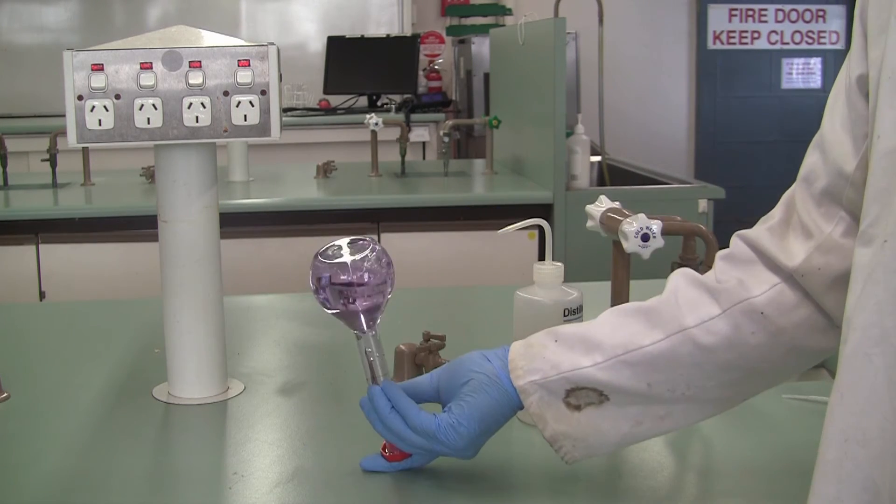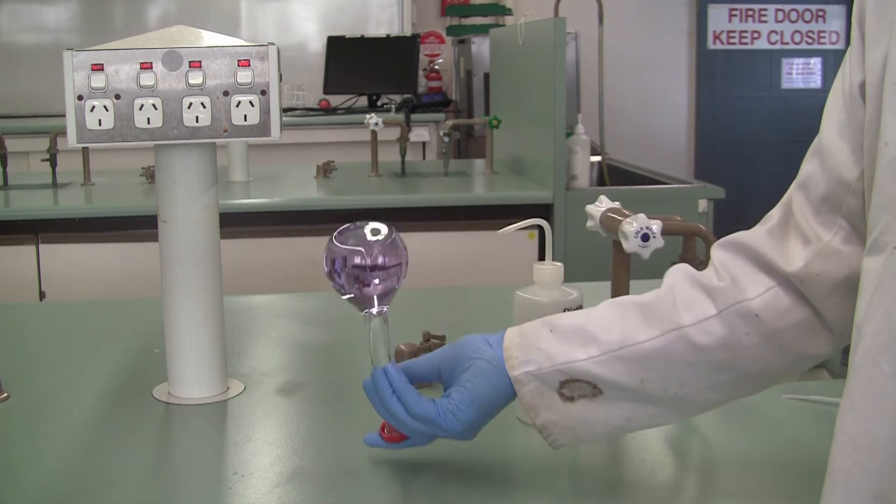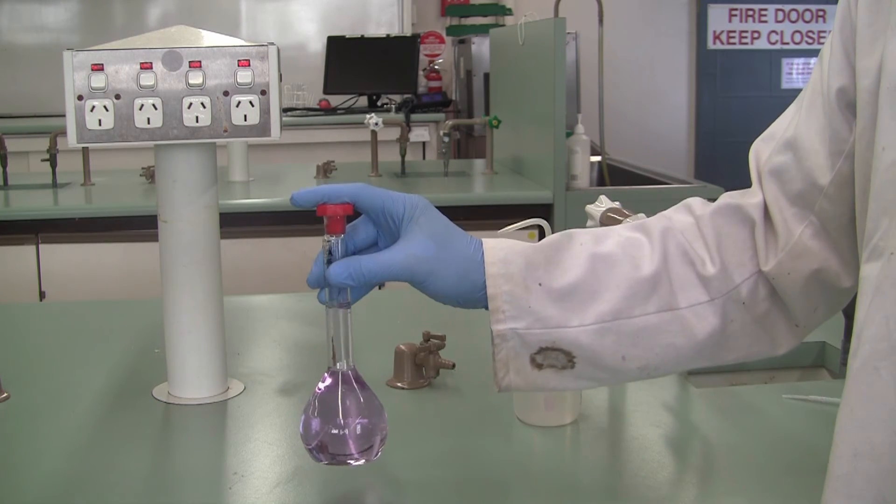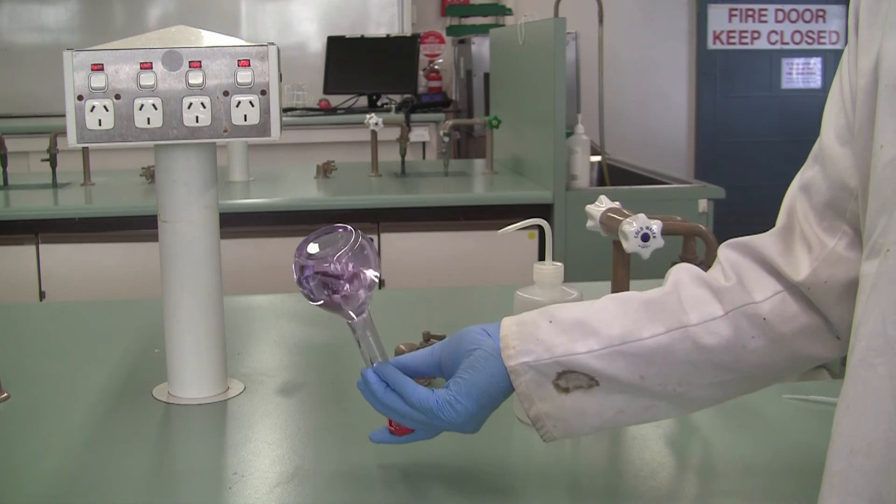And then we mix. We mix by inversion and you should do this at least 40 times. Might be overkill for some simple solutions, but that way you can ensure that whatever you're working with will be well mixed.